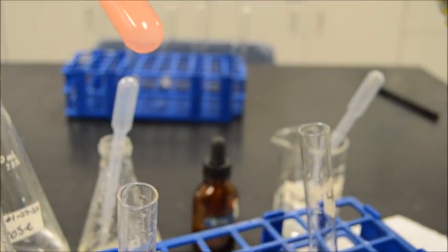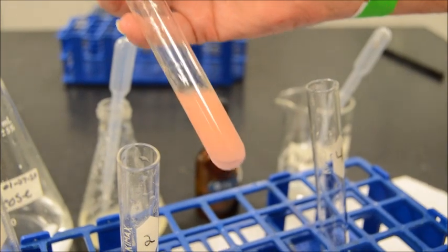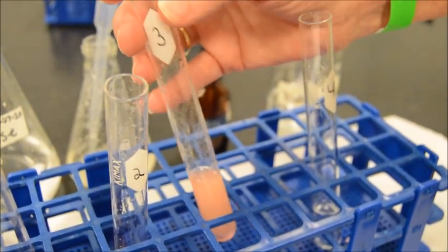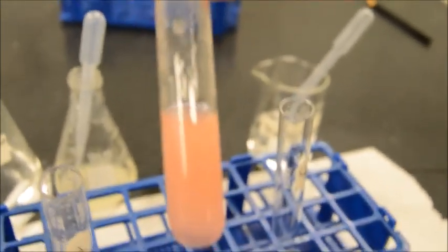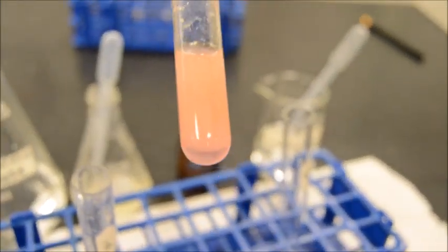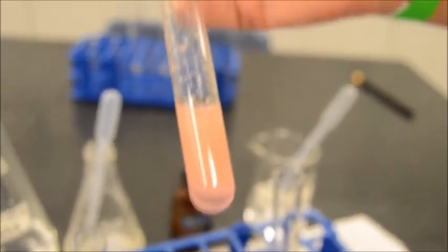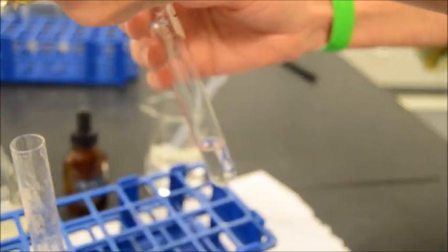Yeah. So we're going to come back to this one in just a minute. The trick is that you got to let it sit. That's right. Yeah. Let it sit for a little bit. In lab, if it sits half an hour or an hour, that's really the better thing. You can really see on the bottom of that. Yeah, you can see that there's, just hold it still there. Let's see if I can get a good shot. And you can really see it getting clear on the bottom, and then it's got a layer at the top. That's giving us a little bit of an indication at this stage. All right, let's do the next one, then we'll come back. Okay, so here's water. So negative control.